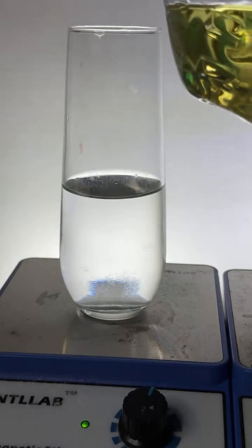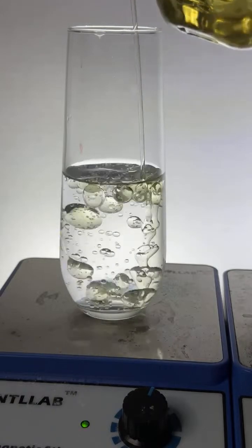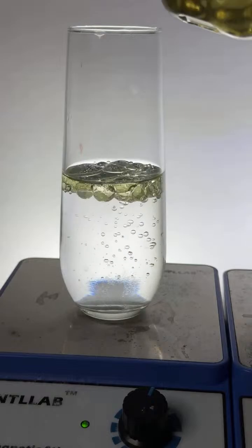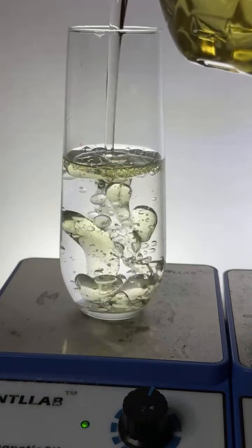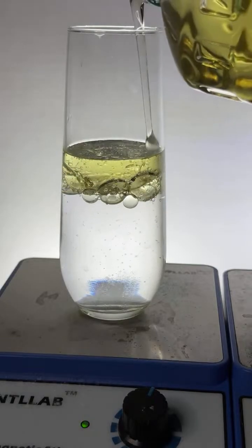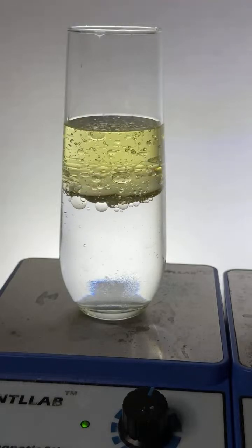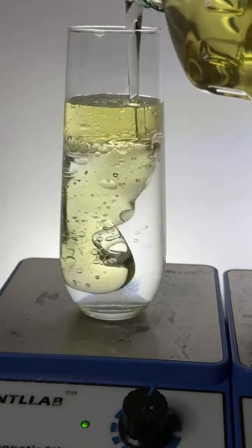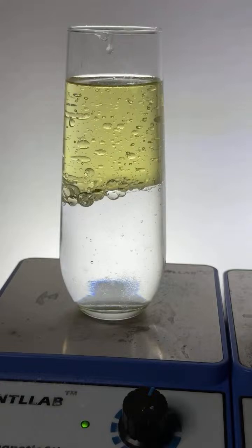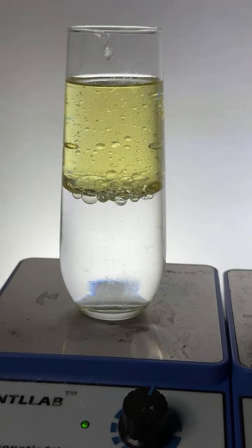It's some distilled water. In goes the oil. And that's just beautiful. Look at that. Nature just does the coolest stuff if you just watch and pay attention. Just gorgeous. It's like a big old blob in there. Come on, nature, do your thing. Look at that beautifulness.